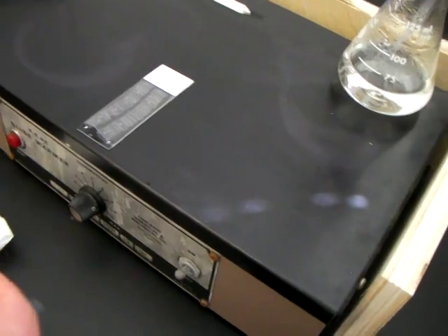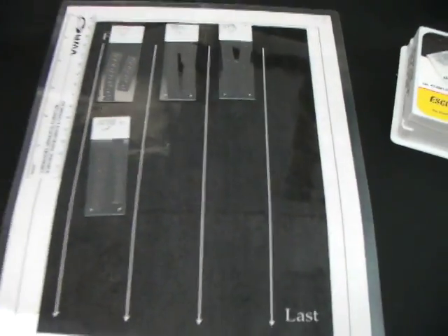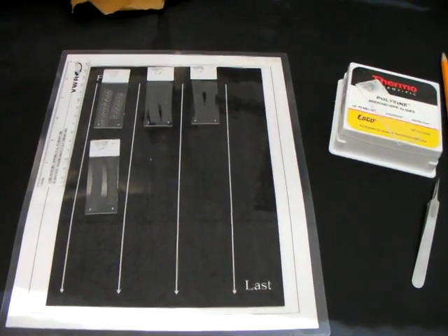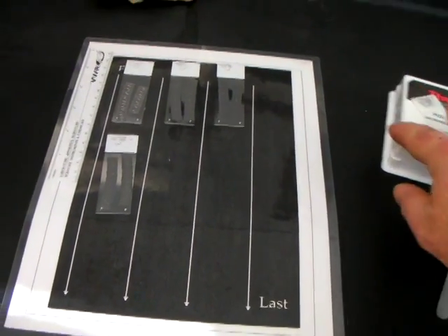And then I'm going to go ahead and set this over here with these other slides I've already prepared this morning, and then let them dry.